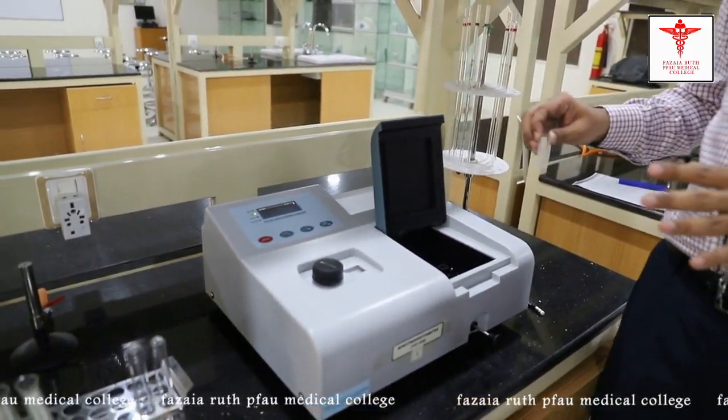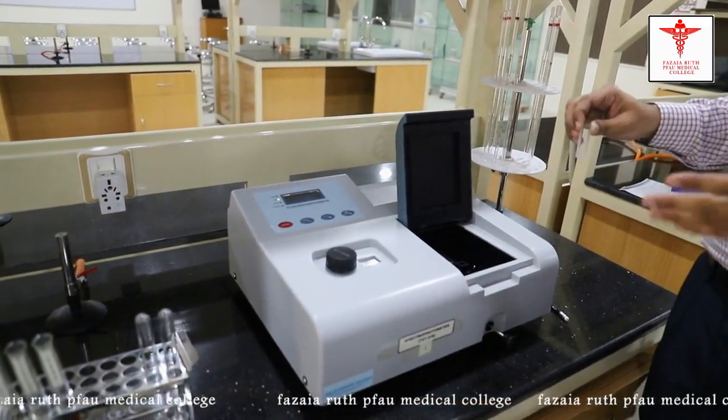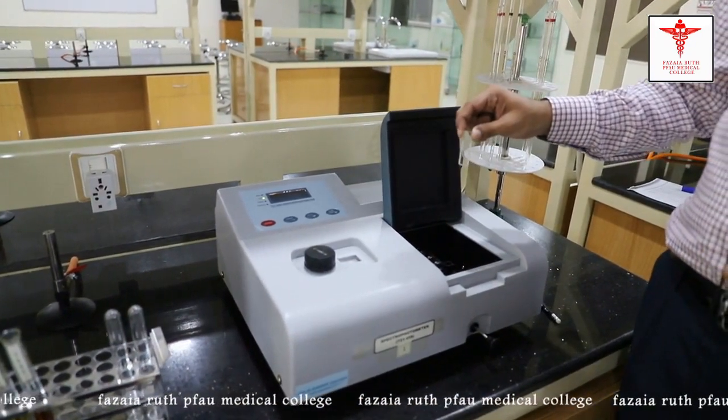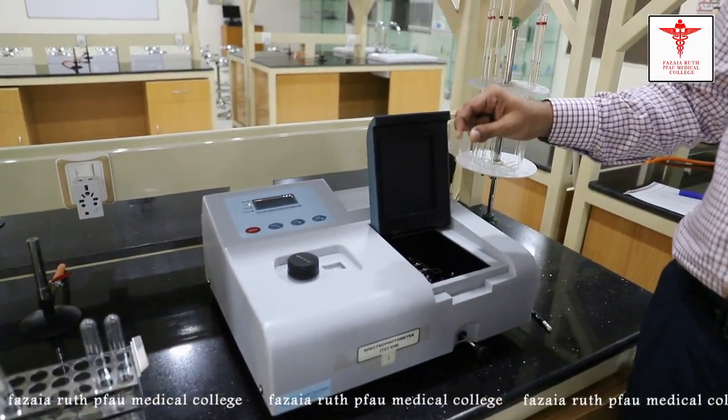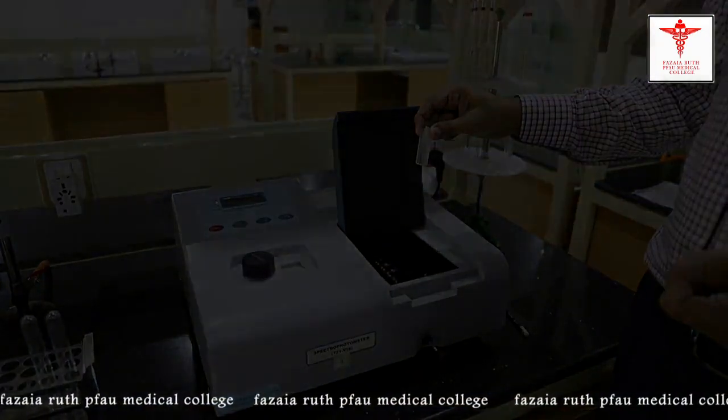This is the spectrophotometer that we'll use, and these are the cuvettes for determining the color in the spectrophotometer.